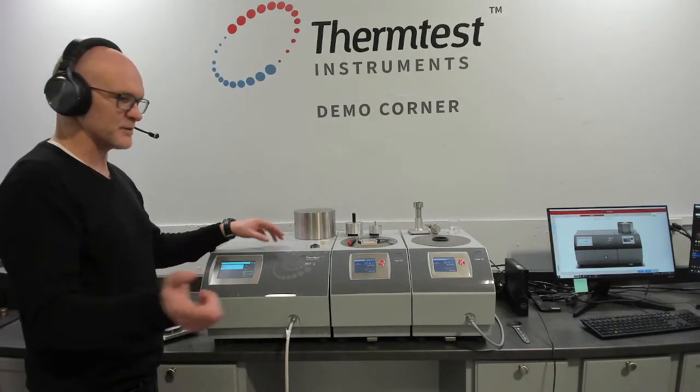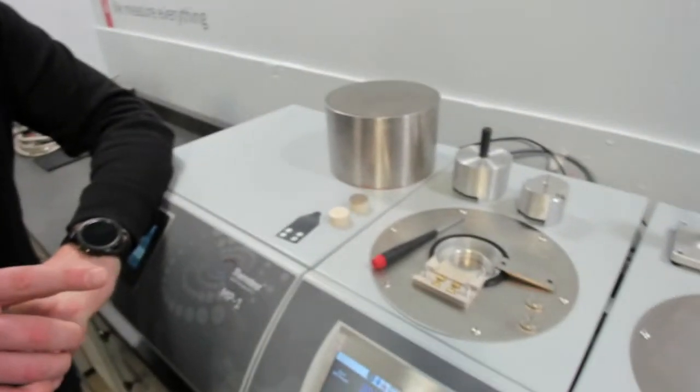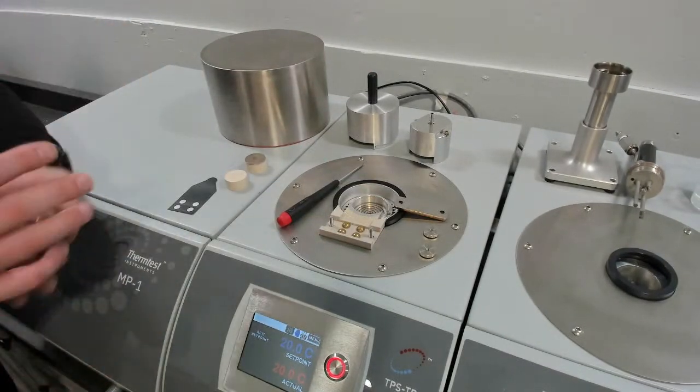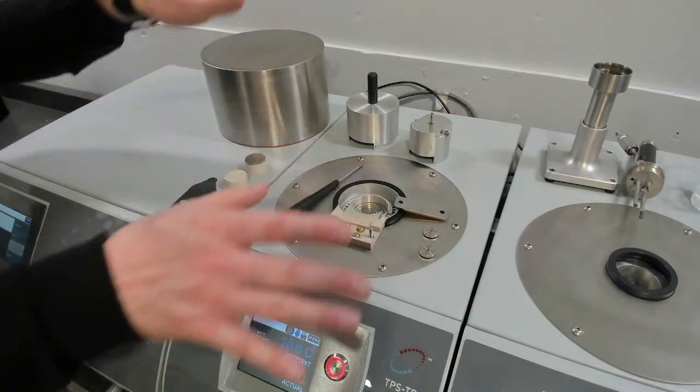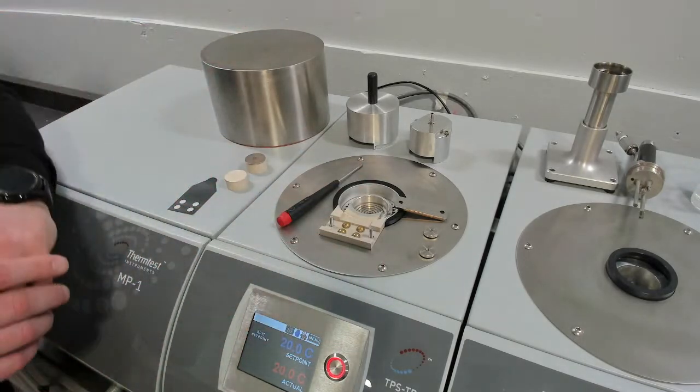So what we really want to show beyond that switch and discussion of that is the temperature platform. So we're going to bring the camera in and talk a little bit about the transient plane source. We have this disassembled just to sort of show full out what the steps of assembly would be, and then you'll be able to see it fully assembled.